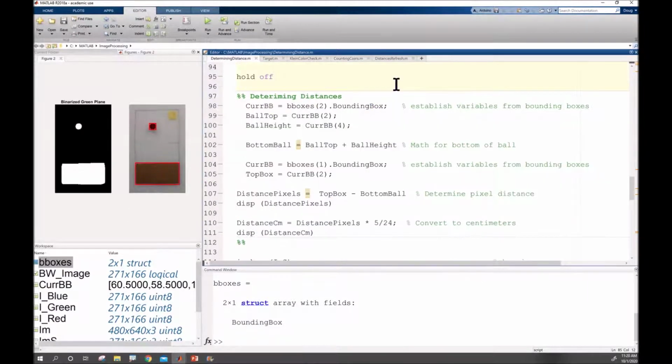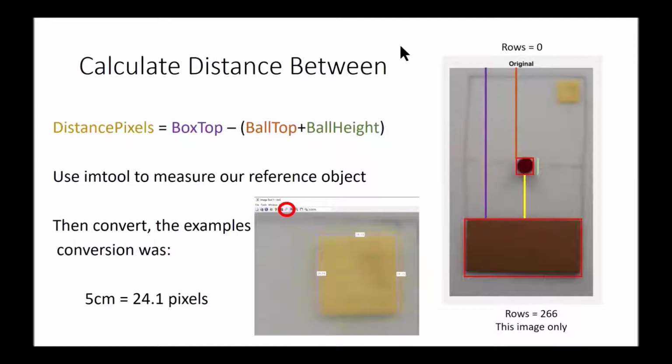I'm then going to determine distances, so I'm going to pull out those values again, and we're going to record values for the top of the ball and the height of it so I can determine the bottom. I'm then going to pull out the top of the box so I can calculate my distance in pixels, which I'm then going to convert down to centimeters. It's a visual of what's going on, so I'm getting my distance for the top of my box, which is my purple line here.